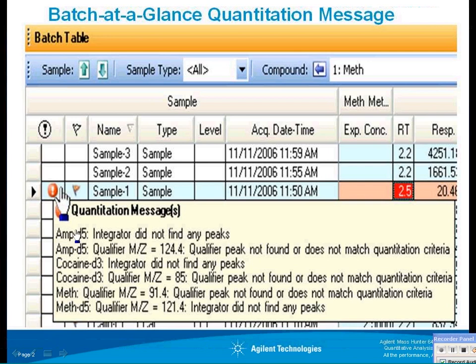The quantitation message shows up in the first column on the left and is a red dot with an exclamation mark in the middle. In this particular example, it's showing you messages about peaks that are not found. In this case, it's mainly the ISTD peaks, the deuterated peaks, that it has a problem with, but also for methamphetamine. I'll show you in a moment that it points out that the qualifier peak is not found and does not match the quantitation criteria.